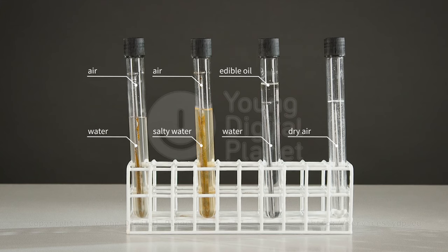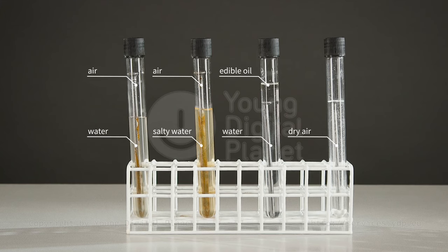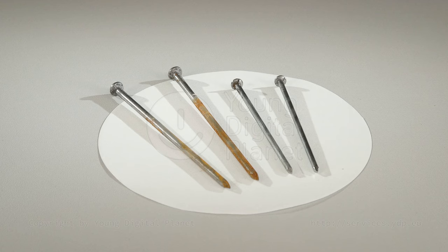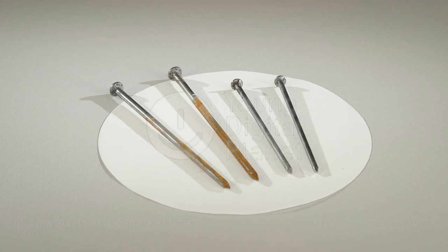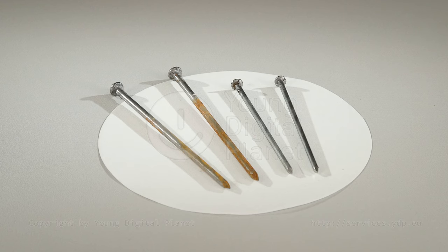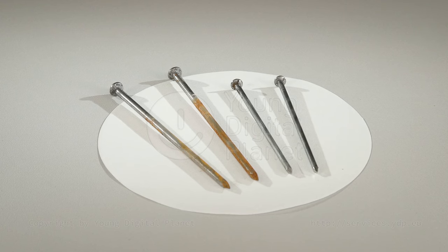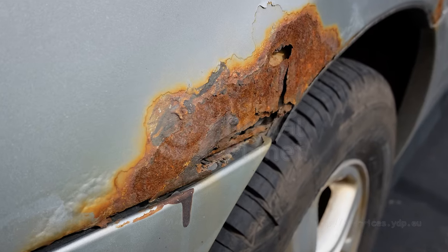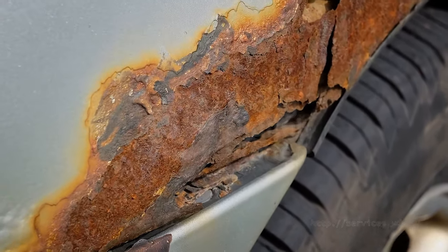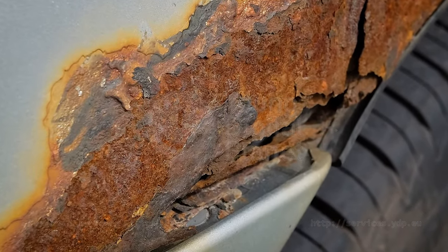Did adding salt have any effect on corrosion? It turns out that the addition of salt accelerated the rusting. That is why the salt spread on streets in winter damages the bodies of cars.